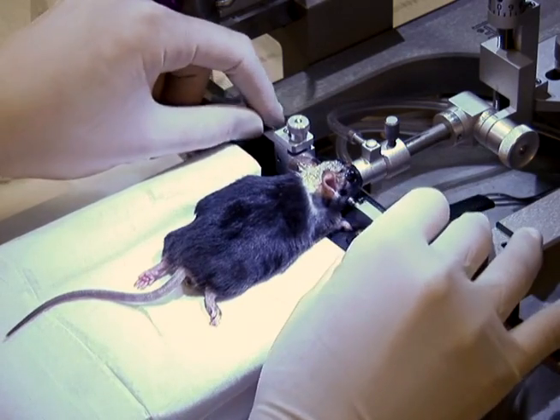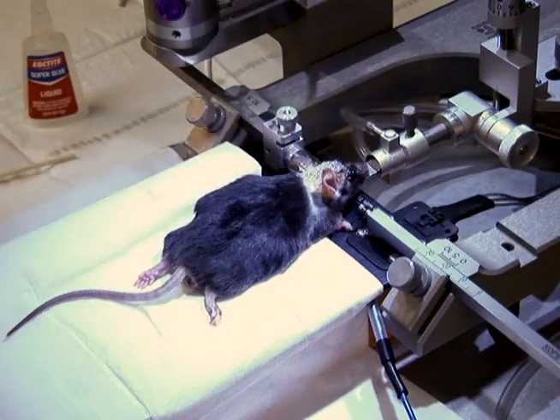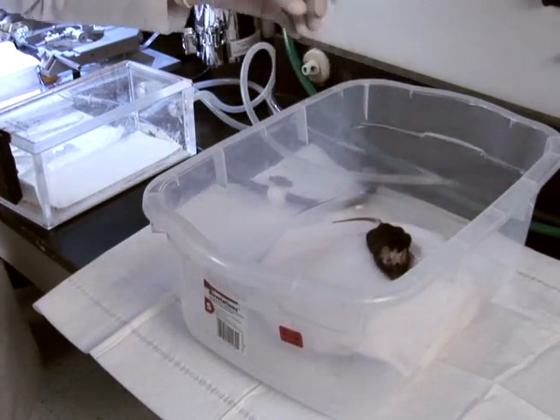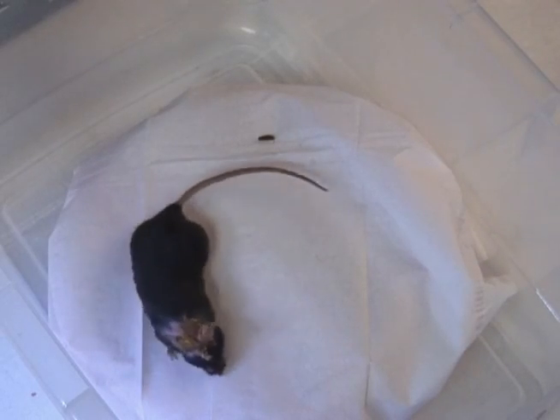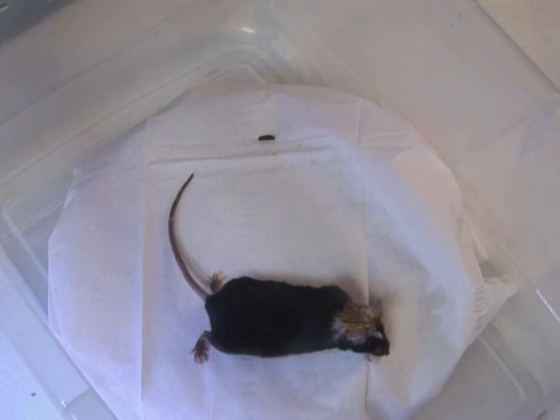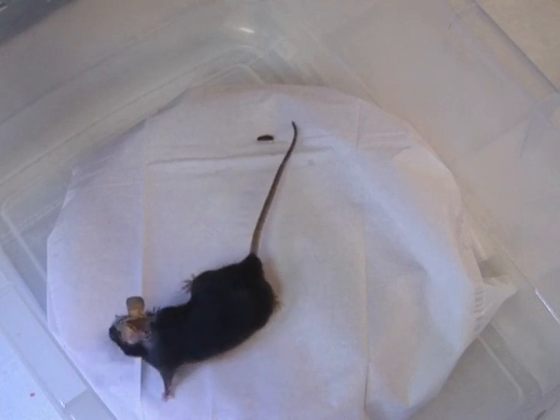Unscrew the ear bars and loosen the nose cone. Remove the mouse from the stereotaxe and place on a warming pad for recovery. Monitor the mice daily after the surgery to check for pain or discomfort and infections, and treat as necessary with analgesics such as carprofen, according to an approved protocol.